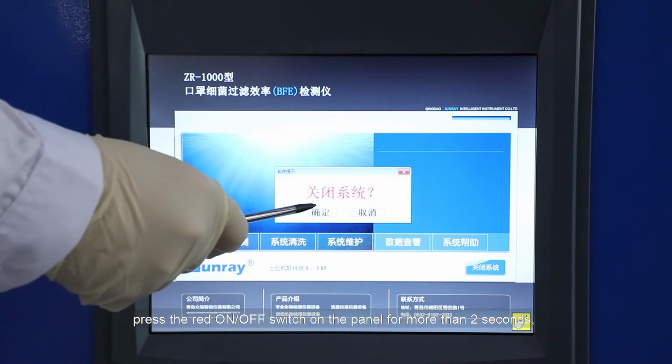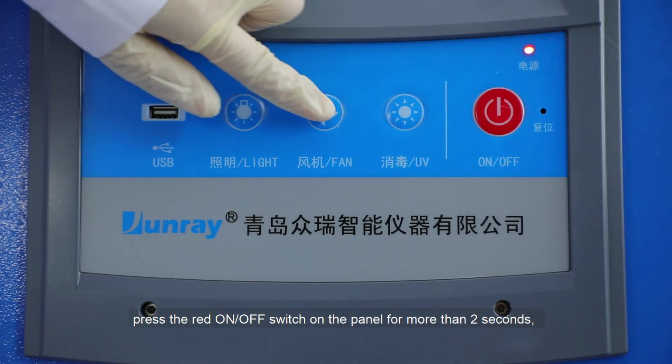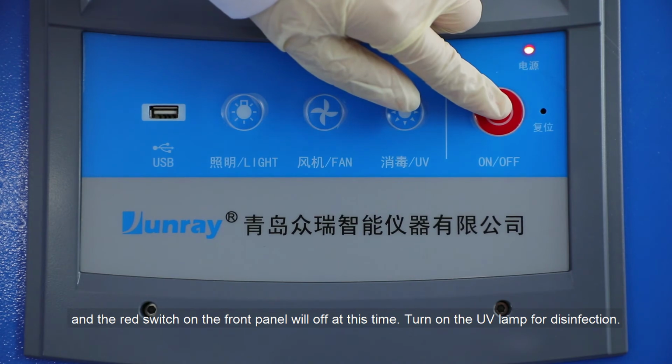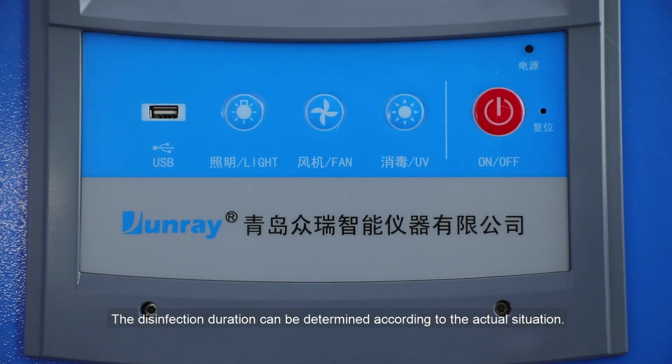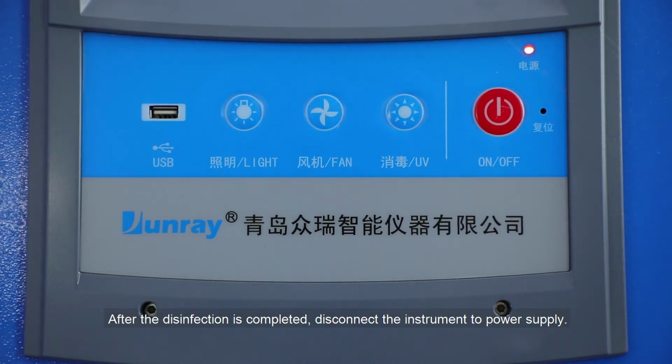Press the red on or off switch on the panel for more than 2 seconds, and the red switch on the front panel will turn off at this time. Turn on the UV lamp for disinfection. The disinfection duration can be determined according to the actual situation. After the disinfection is completed, disconnect the instrument from power supply.